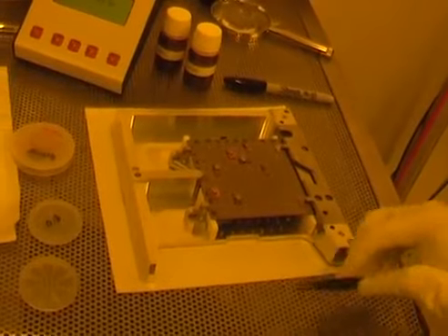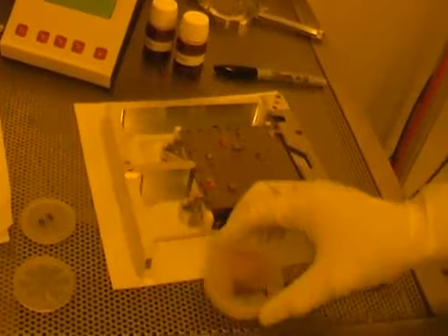Next stage is to load the sample. Now if we look again carefully at the box, we can see that James has written a U in a circle just here. And what that means is the sample is up the right way. And if I open the box, you can see very clearly that it's the right way up, and also that there's a cross very clearly marked, so I know which orientation to put it. The cross goes at the bottom left corner.